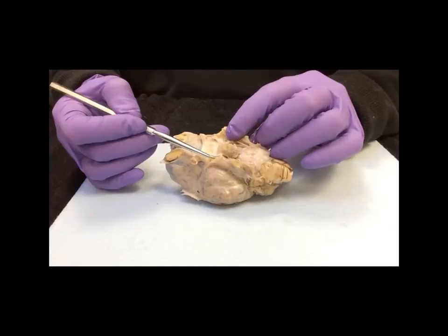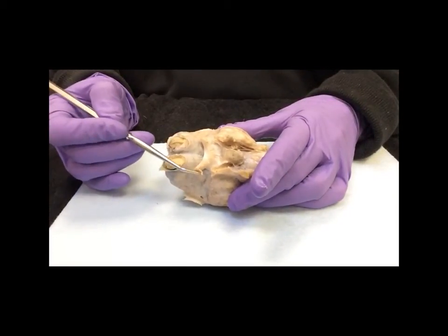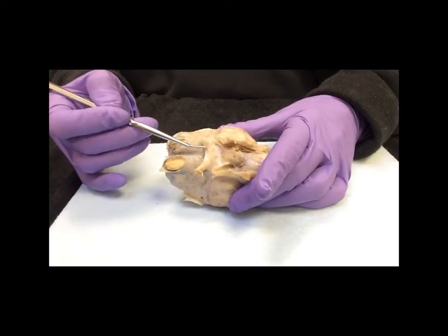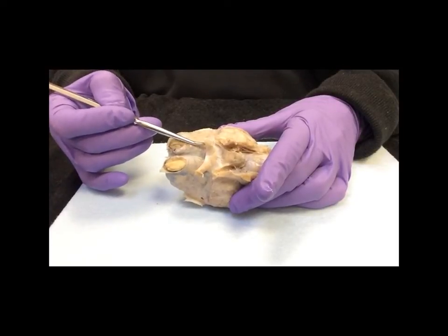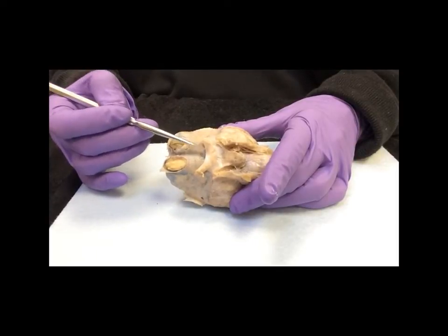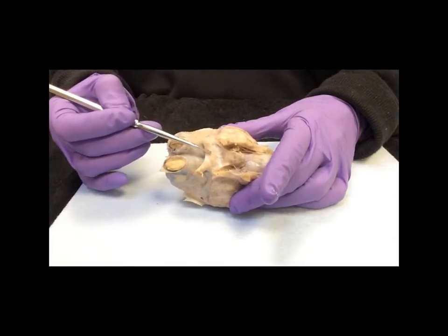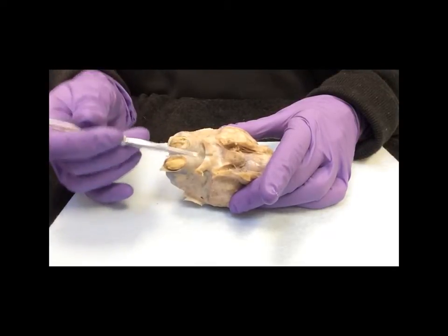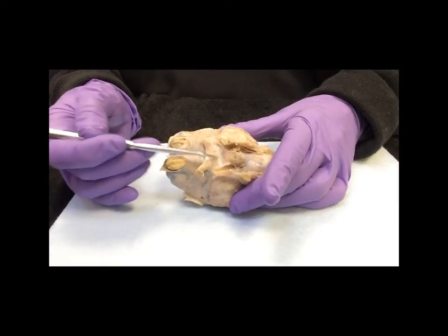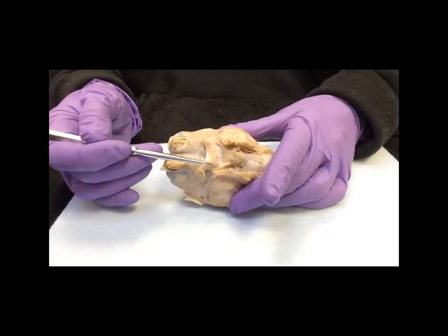Just want to mention at this point, you can also see quite clearly here the 2 optic nerves coming in, right here and right here, noting that bundles of axons in the peripheral nervous system are called nerves. Once they cross over at what's going to be known as the optic chiasm and enter the CNS, they are now going to be called tracts. So it's optic nerves, optic chiasm, and optic tracts.